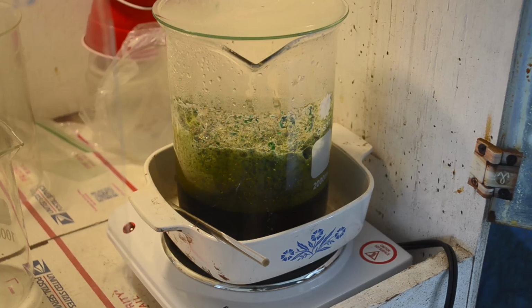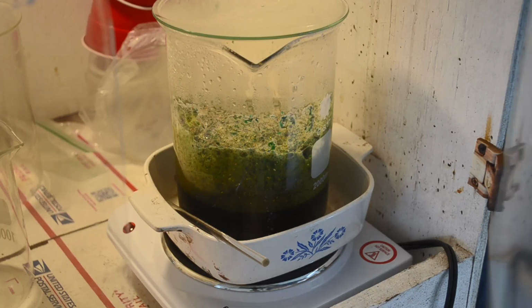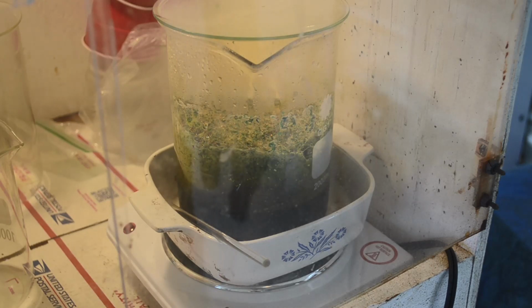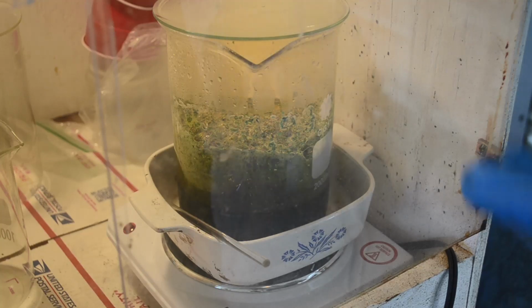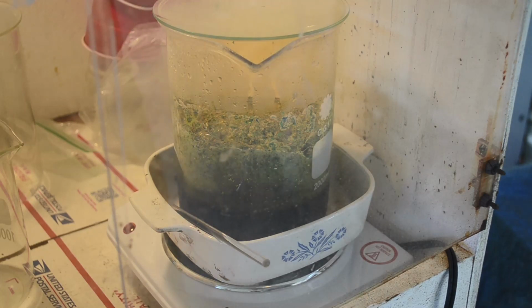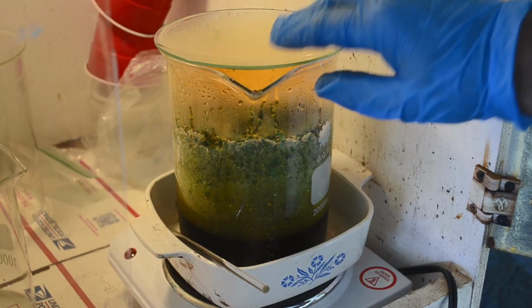I don't know about this. Let's see what happens here. I'd like it to just quietly react, but that doesn't seem to be in the cards. Just want to make sure we don't have a big massive bubble over though. Seems to have calmed down a lot right now. But I put a lot of cold muriatic acid in there, so see what happens when it warms up again. Okay, this foam is just getting out of control again.